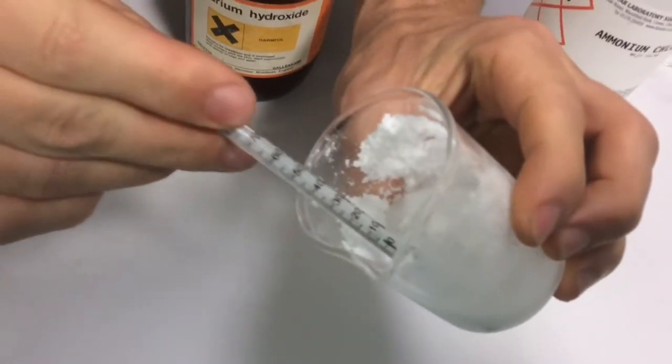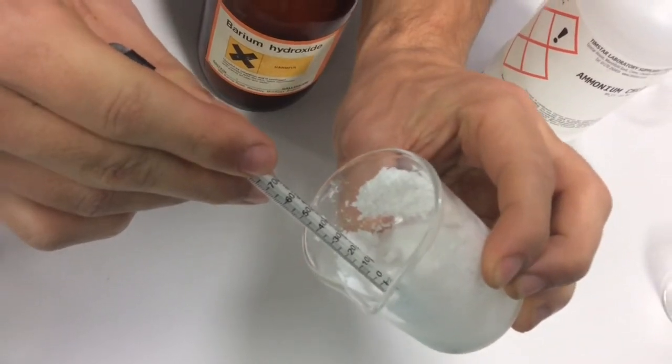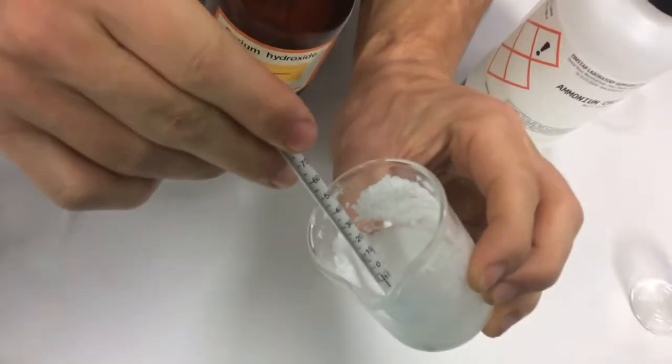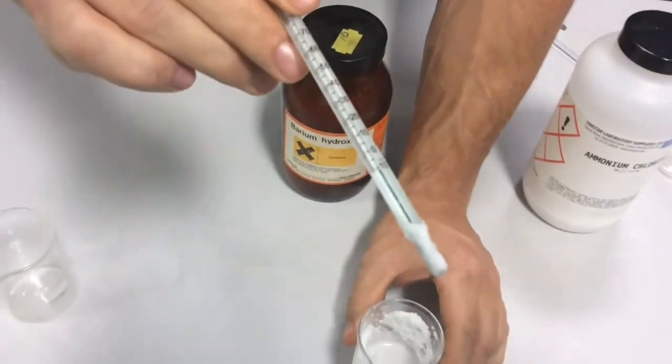Wow, that is going down rapidly. I want to pull it out in a second just to show you so you can see, but that has dropped almost down to minus 10. In fact, if I take it out now, you can see it's gone all the way down to minus 5.